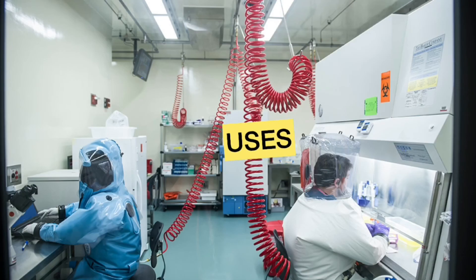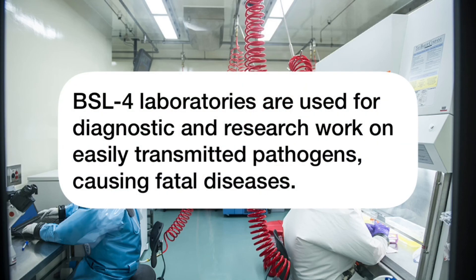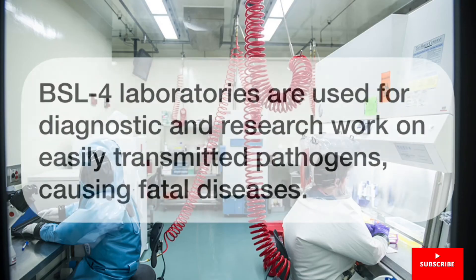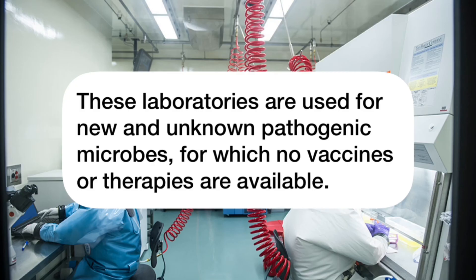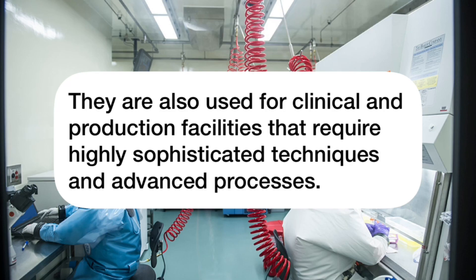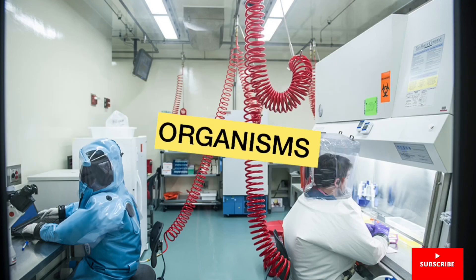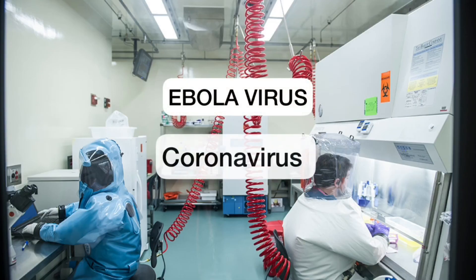Uses of the Biosafety Level 4 Laboratory: BSL-4 laboratories are used for diagnostic and research work on easily transmitted pathogens causing fatal diseases. They are used for new and unknown pathogenic microbes for which no vaccines or therapies are available, and for clinical and production facilities requiring highly sophisticated techniques and advanced processes. Organisms that require the BSL-4 laboratory include the Ebola virus and coronavirus.